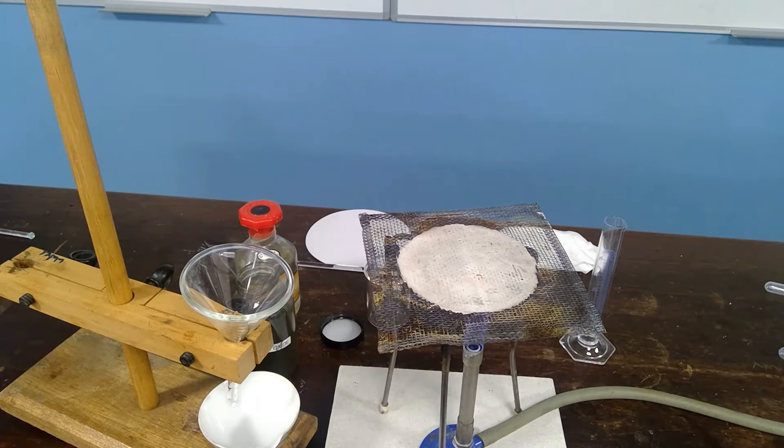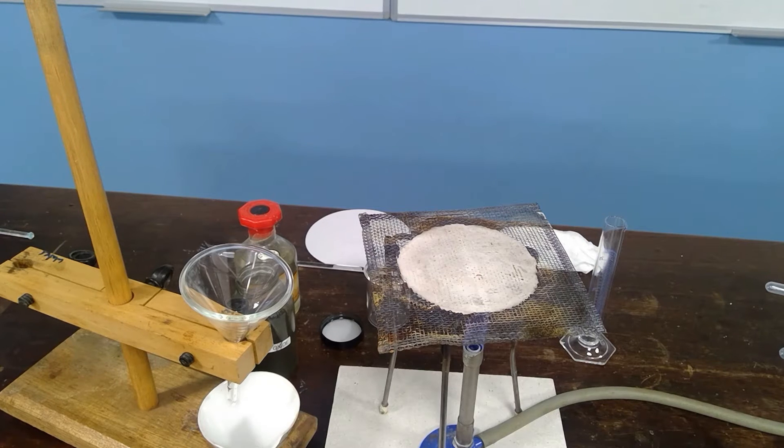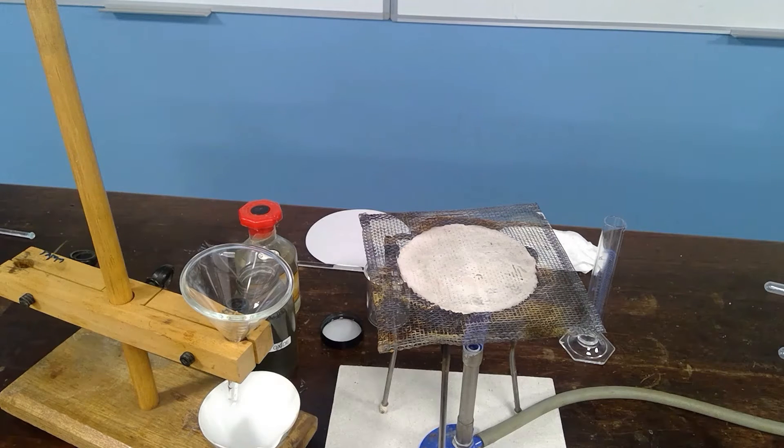This is an experiment to look at the method of making a soluble salt. It is sometimes called the insoluble base method.